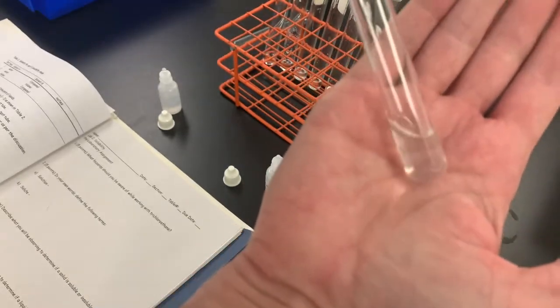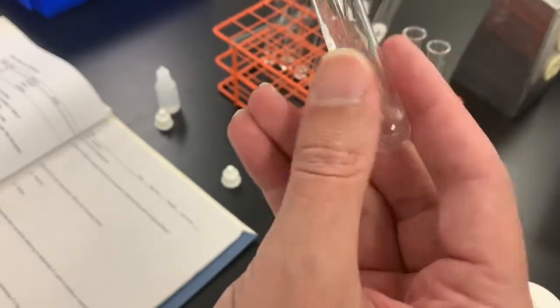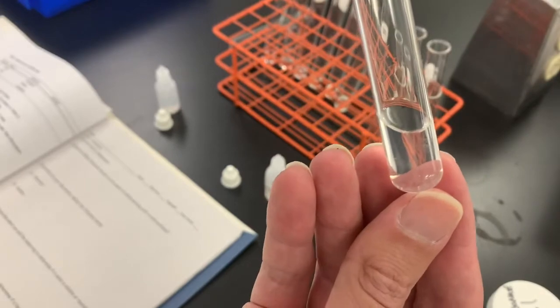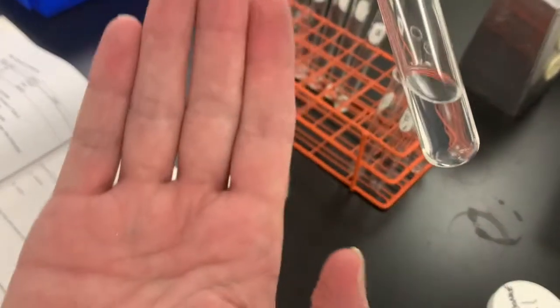And we'll carefully observe what we have here. So that's what it looks like.